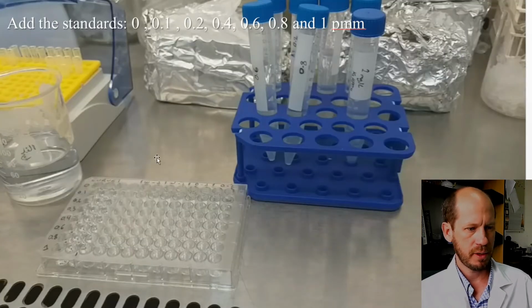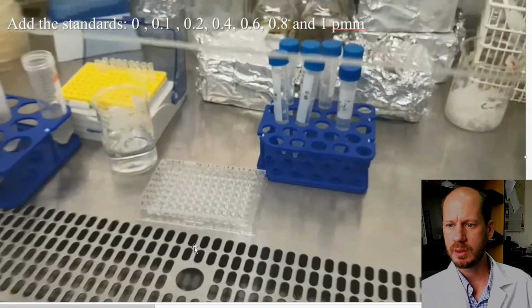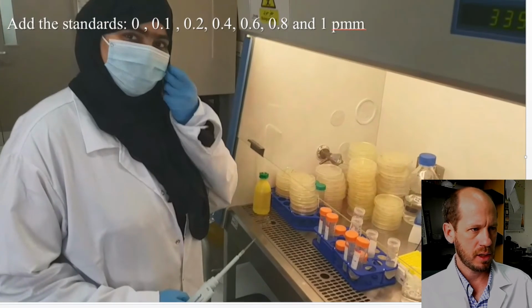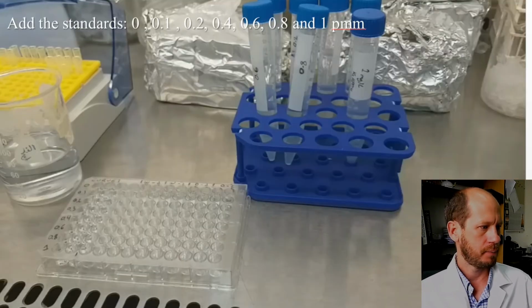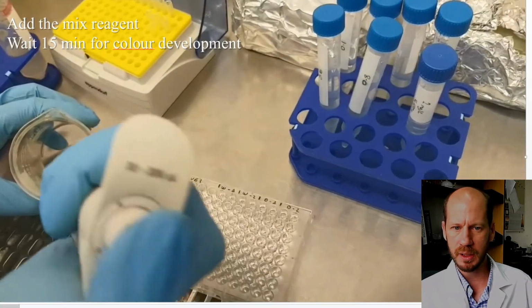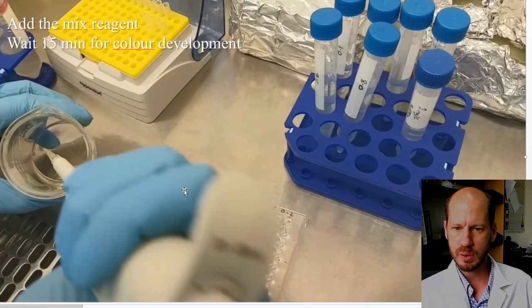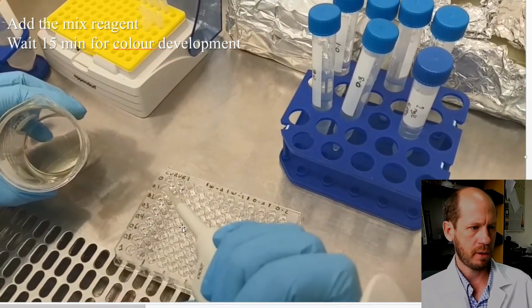So for the measurement, this is what we showed before in the previous class where we talked about measuring phosphorus in soil extracts. This is Lilwa here, and she's pipetting the standards 0, 0.1, 0.2, 0.4, 0.6, 0.8, and 1 ppm into the microplate. This is 200 microliters of the standards and samples being pipetted into the microplate. The first one on the curve is water, the 0 concentration, and then you have the rest of the curve being pipetted on the first 2 columns of the microplate.